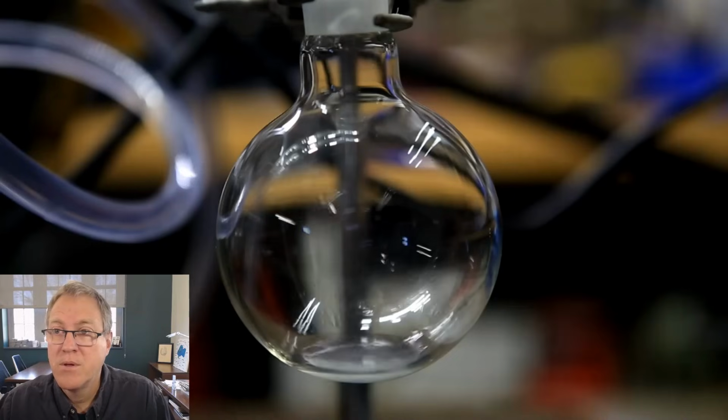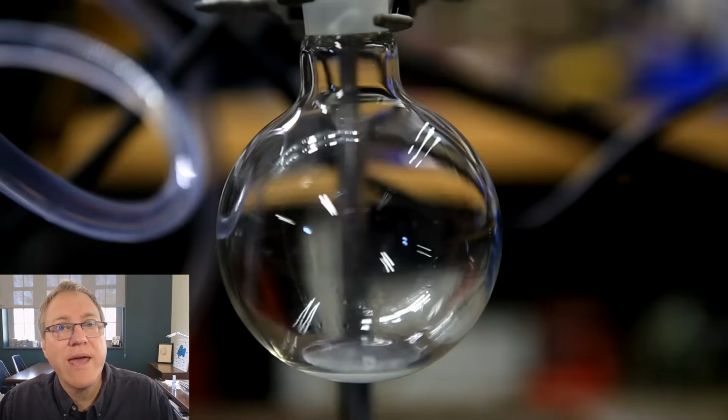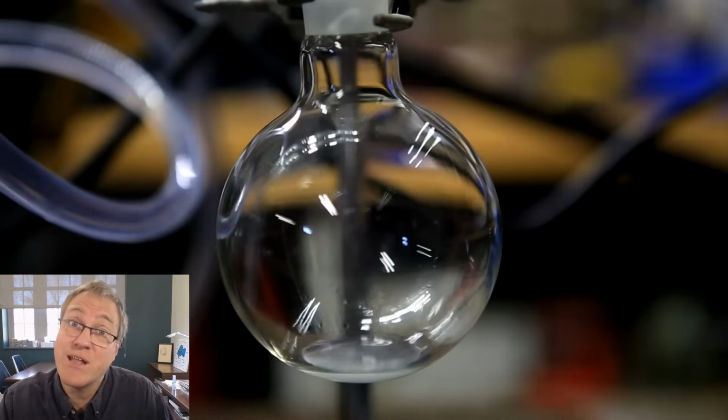The distillate that came over below 60 degrees Celsius was cloudy and it was discarded. So normally when I think of cloudy organic layers, it's probably got some water in it. So there might have been some residual water. He's gotten rid of that material. There is a cost of getting rid of that material. His yield will be lower, but presumably the stuff that he does isolate later will be of higher purity. So you've got to sacrifice some yield to get higher purity.